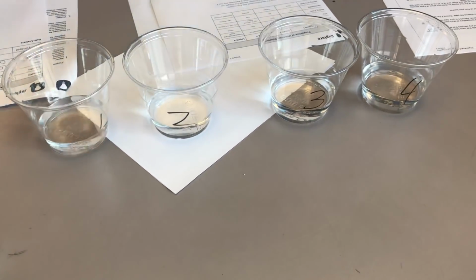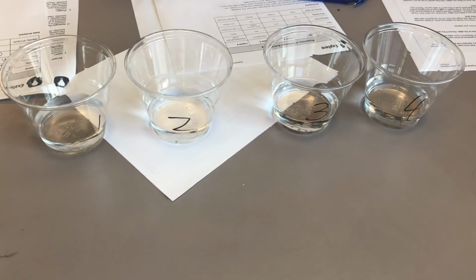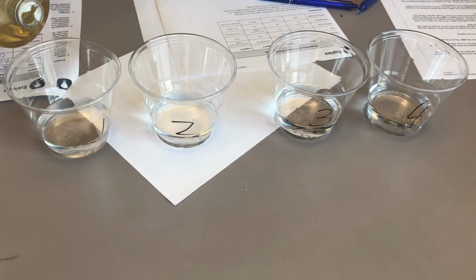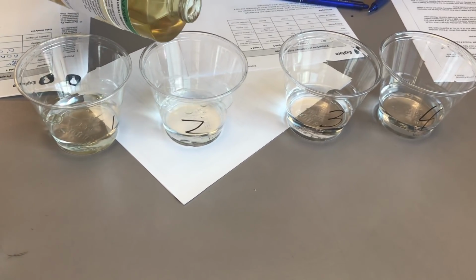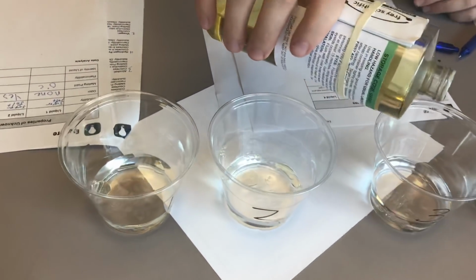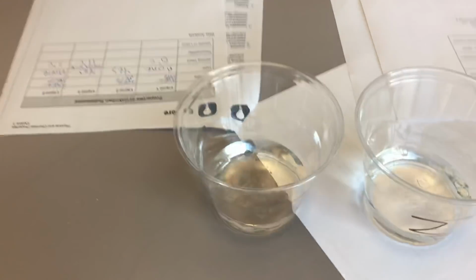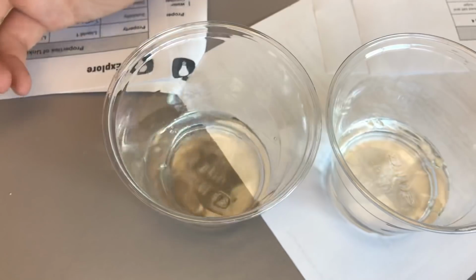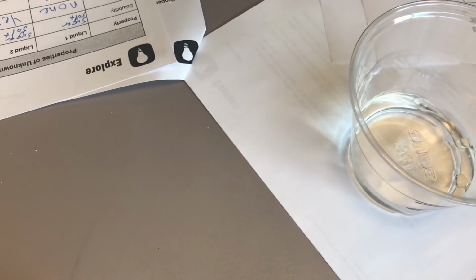Okay, and then next we wanted to see how the corn oil would do. So we'll put a little bit of corn oil in each. You can really see it kind of bubbling up to the surface, just like it did in our observing density activity. Okay, so we can see in 1 here, you can kind of see the bubbles on the top, and now it's kind of filling up the whole top surface. We get a side view maybe. You can kind of see there's a layer. Number 2, we can kind of see that there's the layer of oil as well.